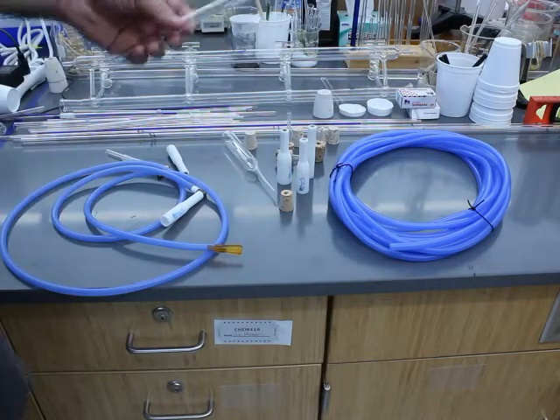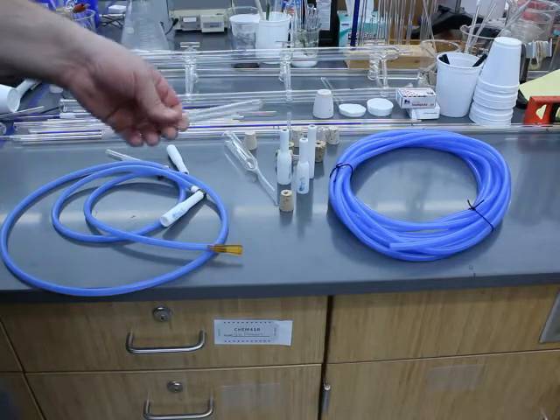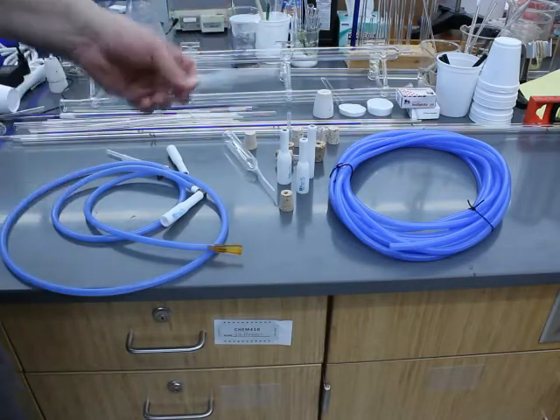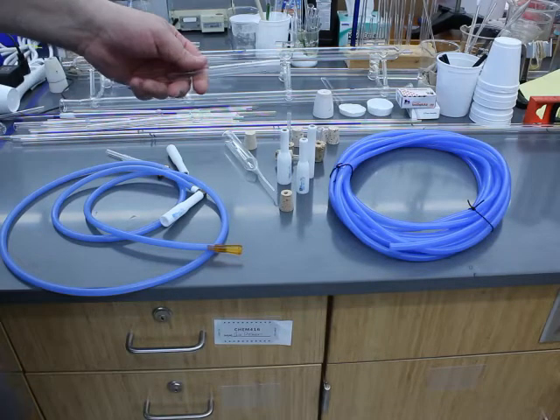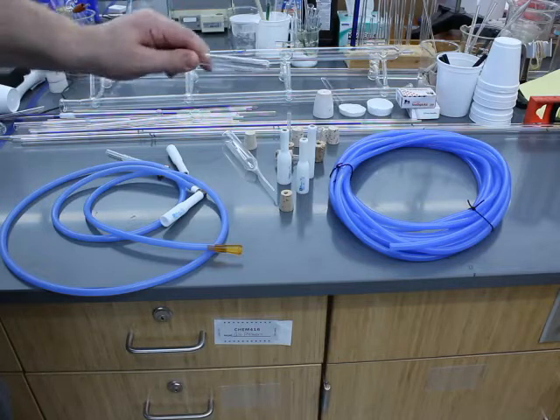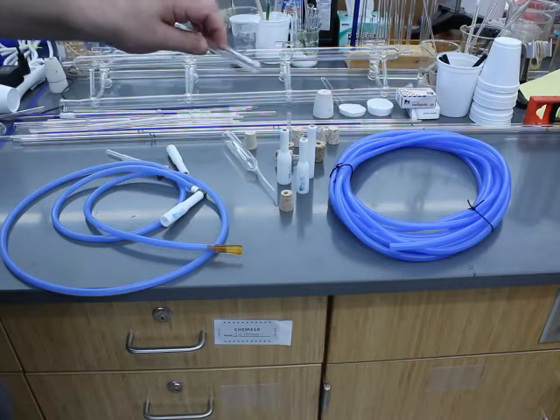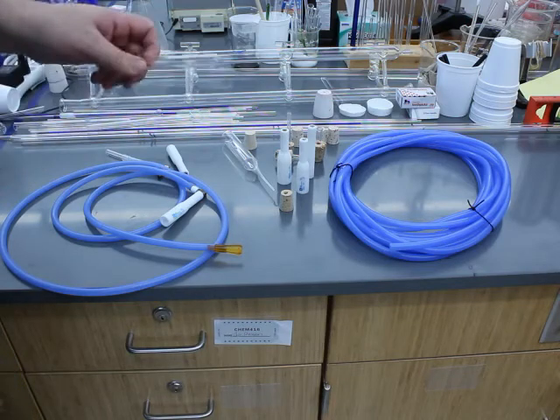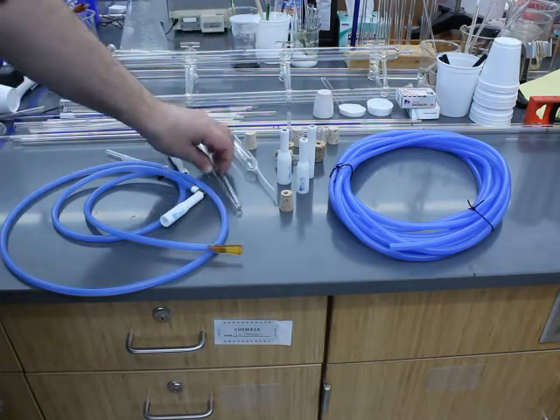This is a little bit subjective because if you have a lot of experience blowing directly into the glass, you probably are going to be fine. If you're new to glassblowing, learning how to use the blow hose can really help out because you can see what's happening as you blow into the glass.